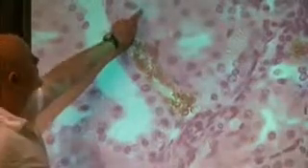So this one right here, which is not in focus, this is a distal convoluted tubule. So it's cut this way, right there. It's not in focus. But as you can see, the middle of the tube over there, and I focus it now, is fairly open. Okay? So that's a distal convoluted tubule over here, where this is a proximal convoluted tubule.